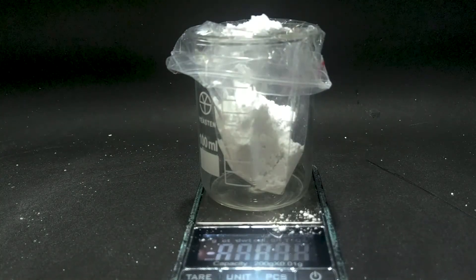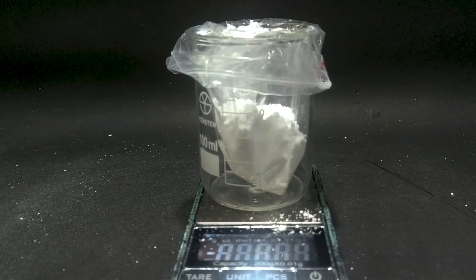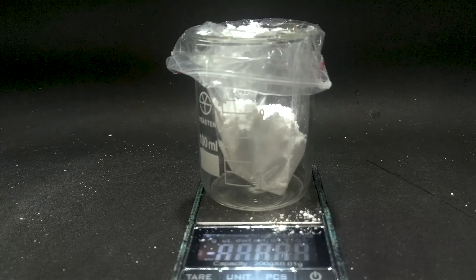Final yield is 85% due to some powder stuck in the blender and I splashed a little powder onto the table.